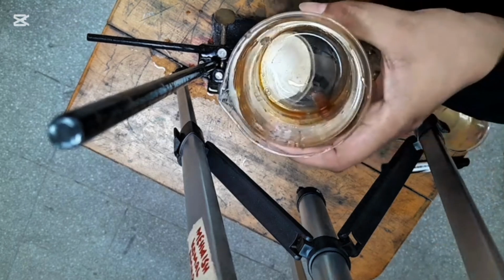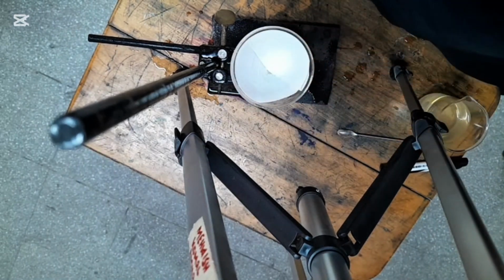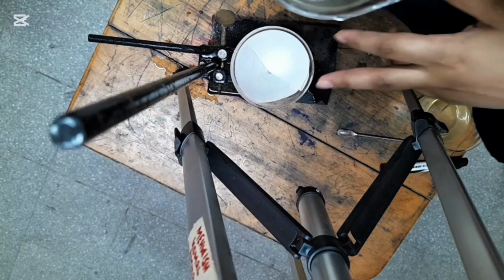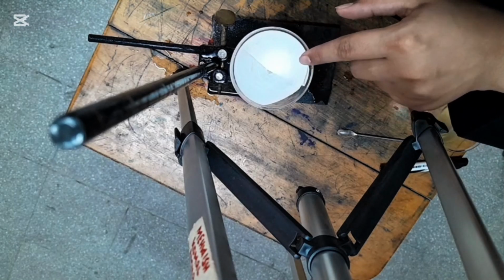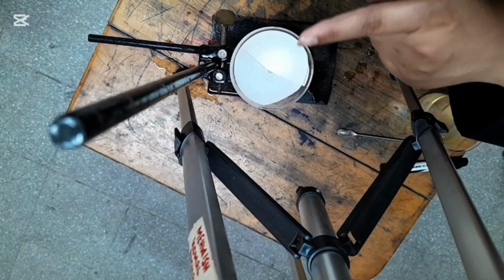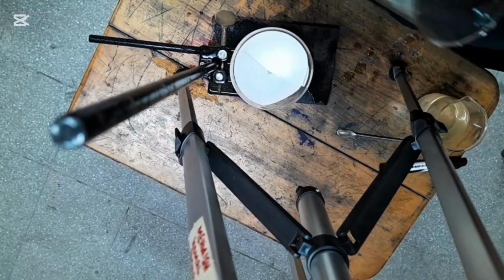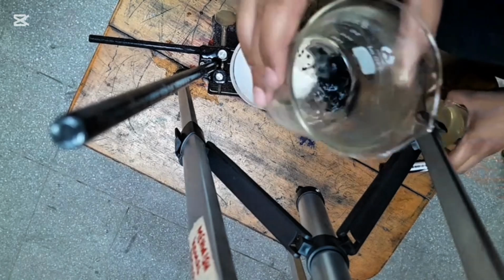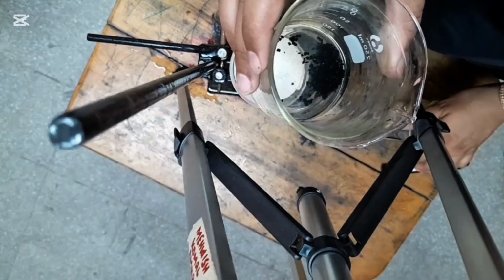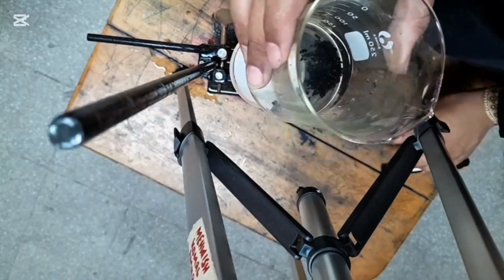So this is another beaker which I kept below the funnel. This is the same funnel which has the filter paper on it with nothing on the filter paper. After the filtration of the suspension, you will see that there will be a residue of the sand particles. A suspension is basically a mixture formed when the solute and solvent are mixed together.